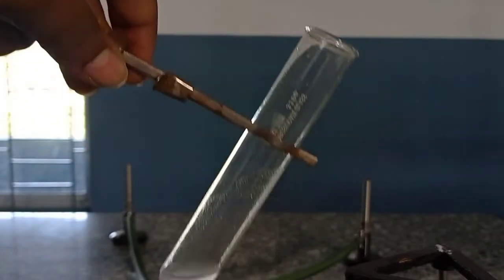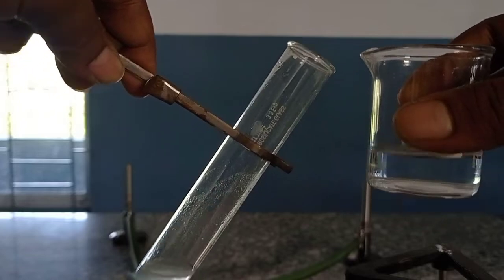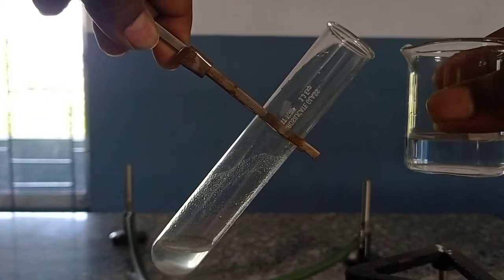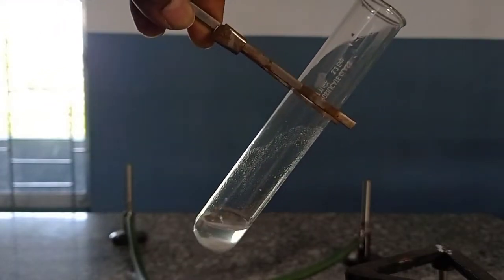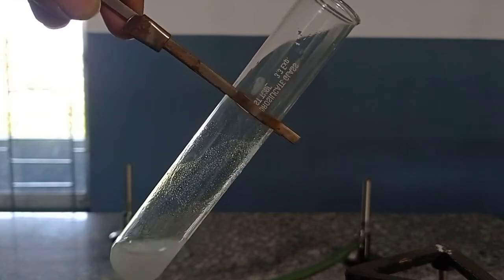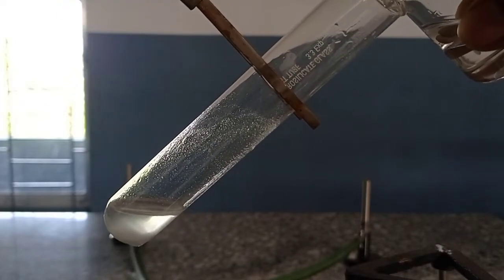Now I will tilt the test tube at a certain angle, say 45 degrees, and then I will add acetic acid. Let's see what happens when I add acetic acid into this solution. You will notice that immediately bubbles will form. Please pay close attention — I will explain what is actually happening.